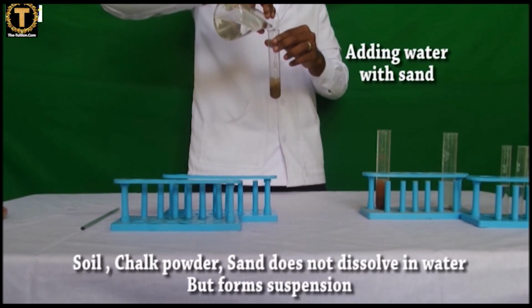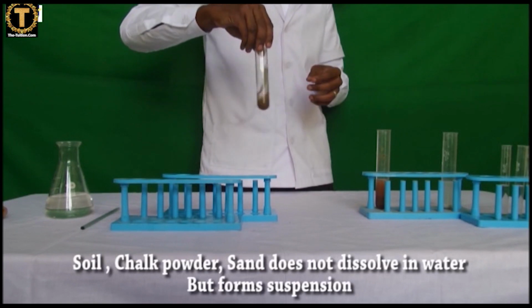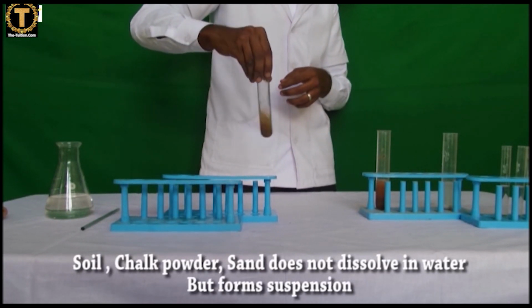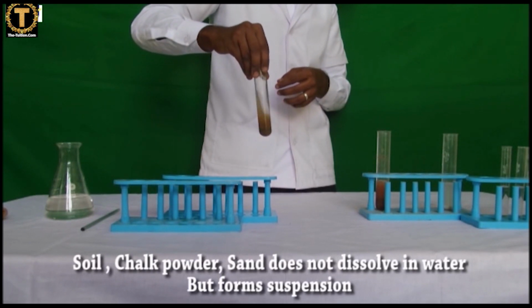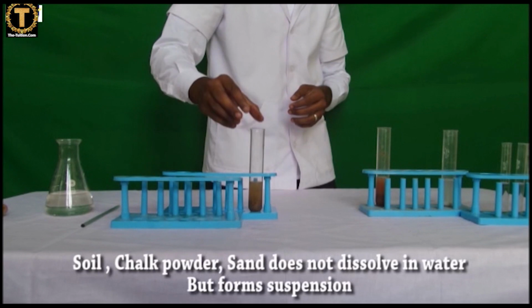Suspension of sand in water. Take 2 to 5 ml of distilled water, add half a pinch of fine sand in it. Stir well, keep the test tube on the stand and record your observation.